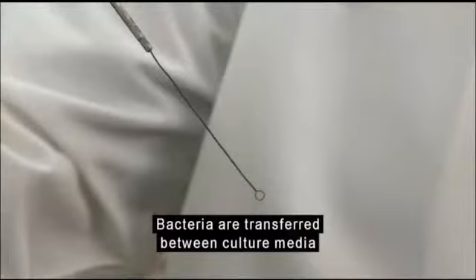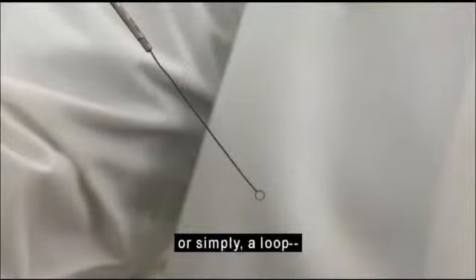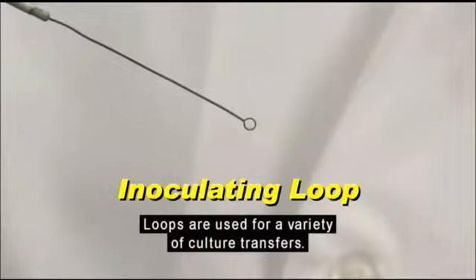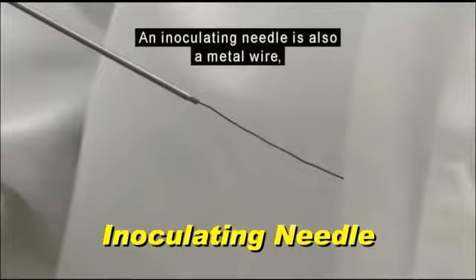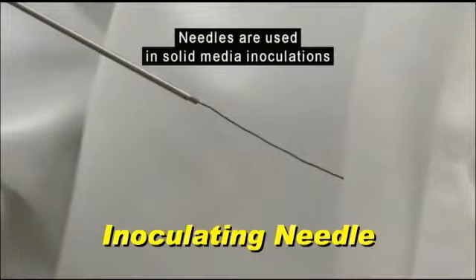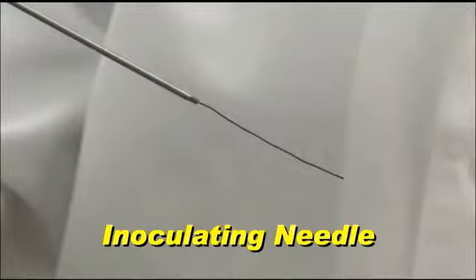Bacteria are transferred between culture media using an inoculating instrument. An inoculating loop, or simply a loop, is a metal wire that ends in a closed loop at the tip. Loops are used for a variety of culture transfers. An inoculating needle is also a metal wire, but it doesn't end in a loop. Needles are used in solid media inoculations that require penetration, or stabbing, of the medium.